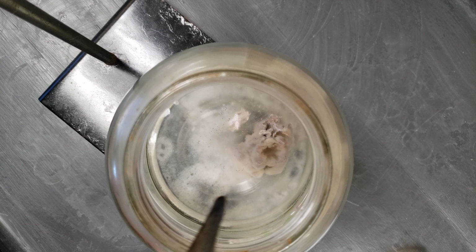All right, today we're going to talk about the difference between atoms and ions. And in here you see we've got some chunks of sodium metal. And it's a very soft metal. You can see if I just kind of stab it with the spatula there, you can pick it up. So it's a very, very soft metal. And so I broke it up into pieces.